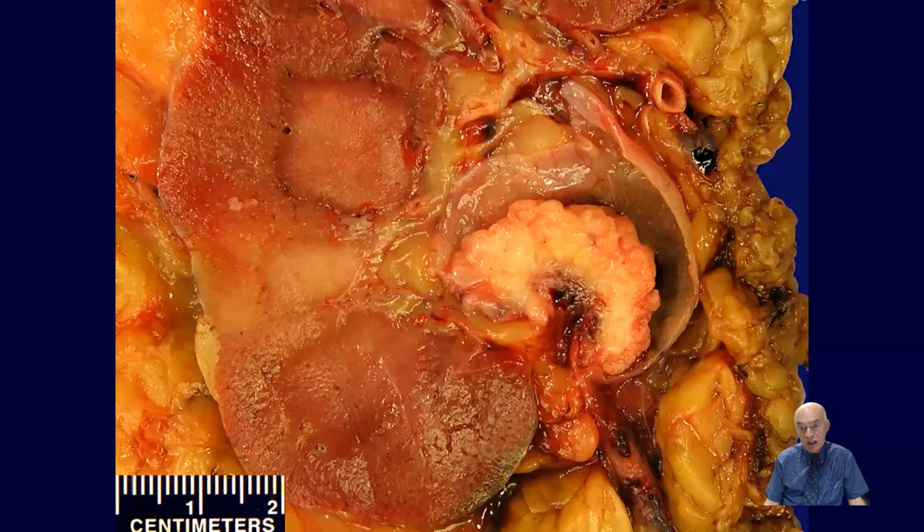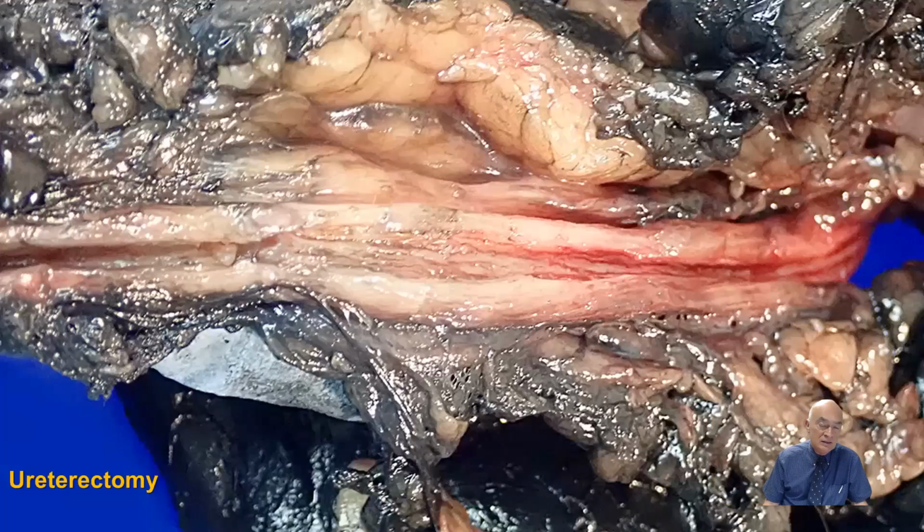Here is another tumor that has a more aggressive appearance, probably involving not only the surface, but also going deeper into the underlying subepithelial or muscular tissue as well. And then again, always remember that every ureter that you find has to be dissected and cut longitudinally. In this particular case, there are small polyp formations that were found on microscopic examination to be areas of papillary urothelial carcinoma with no evidence of invasion.